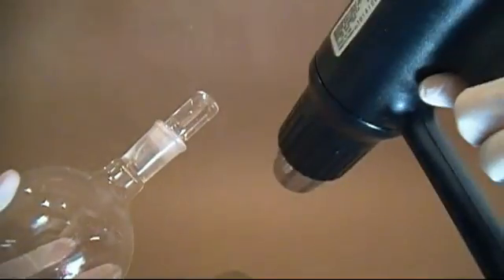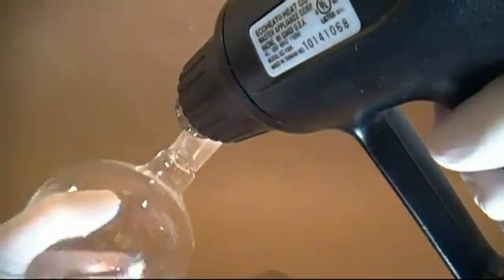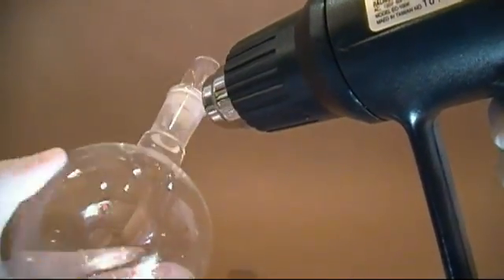It's inevitable. If you do chemistry long enough, sooner or later you're going to get a glass stopper or a glass joint that is stuck. Using force to separate them is not an option. So here's what you do: get a heat gun, put it on high, and begin to heat the seized-up joint. You don't have to leave it on very long — about 30 seconds will do.